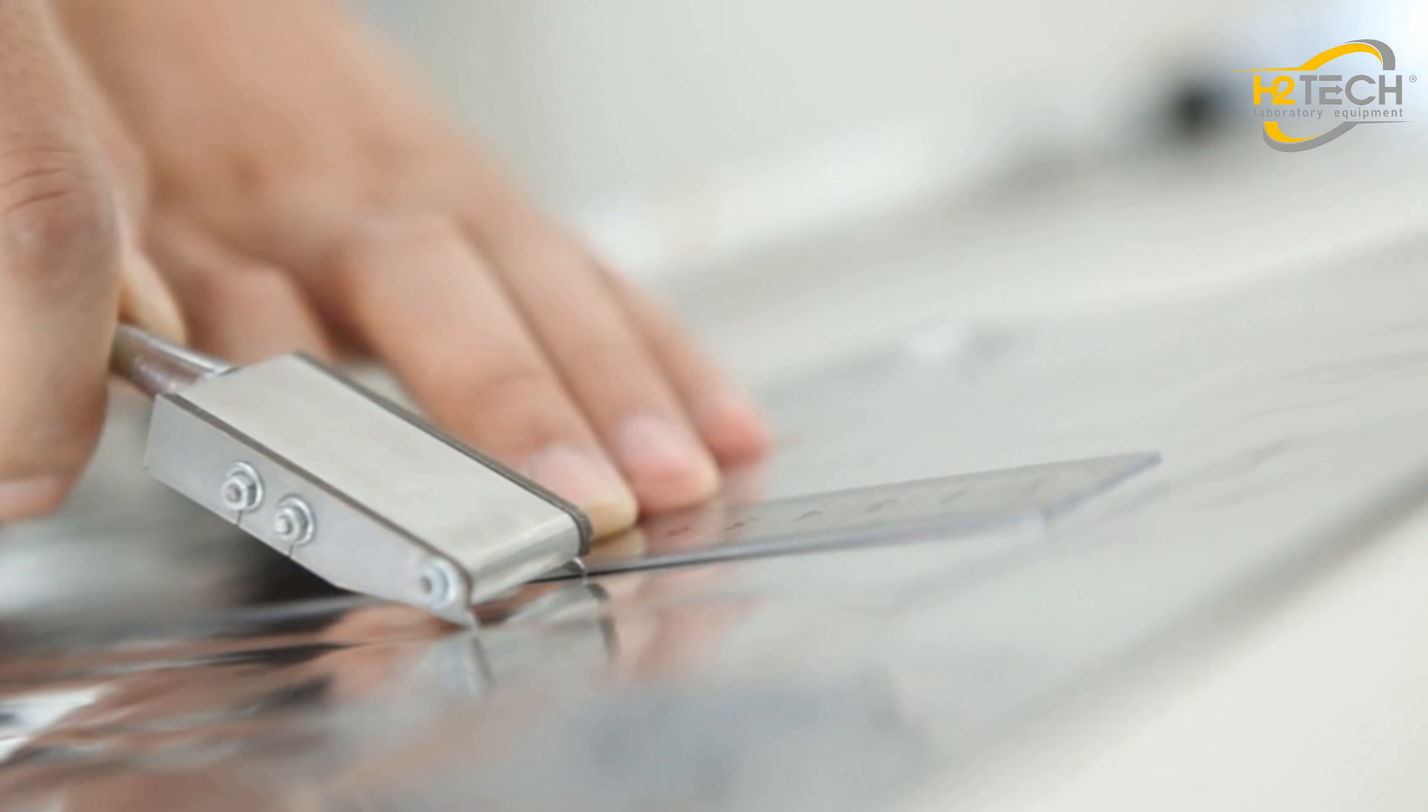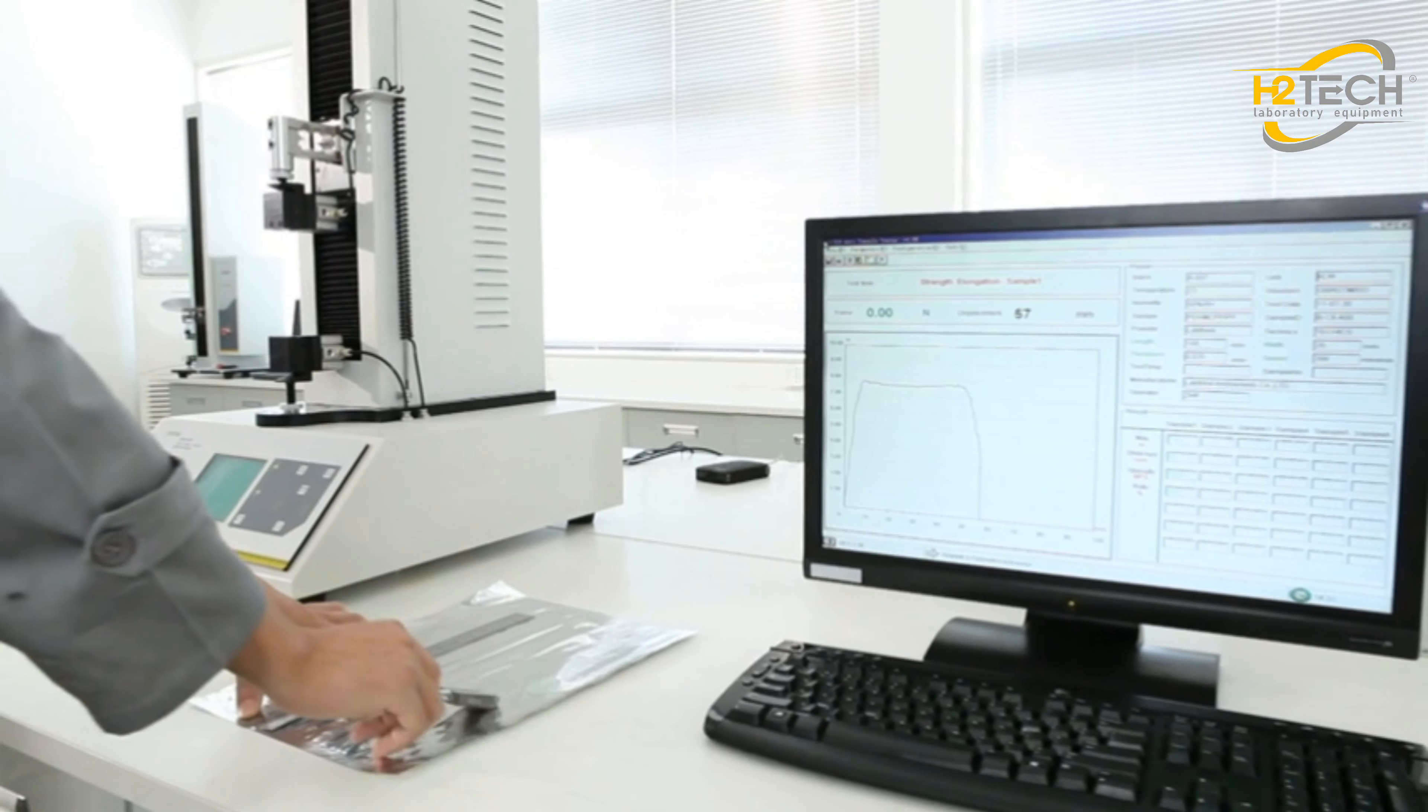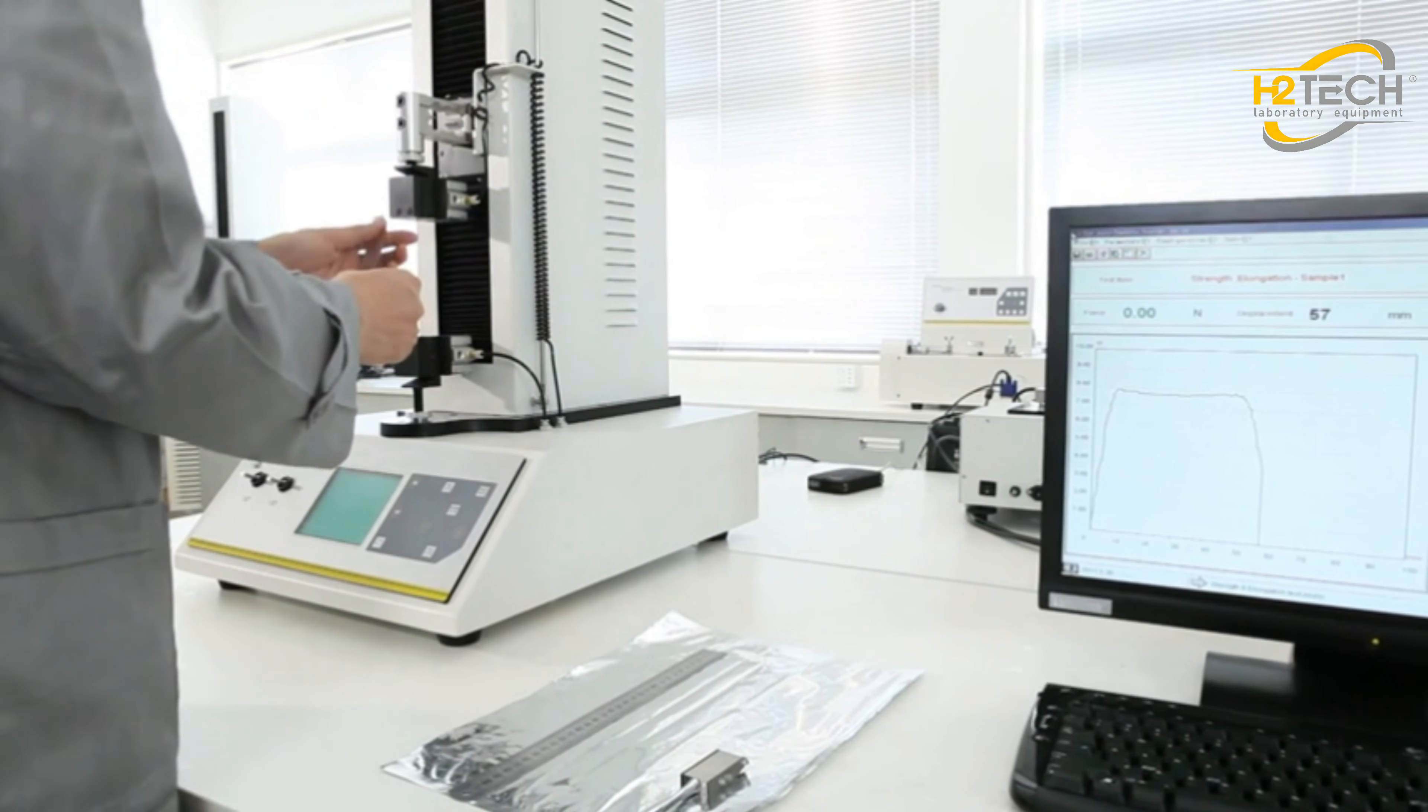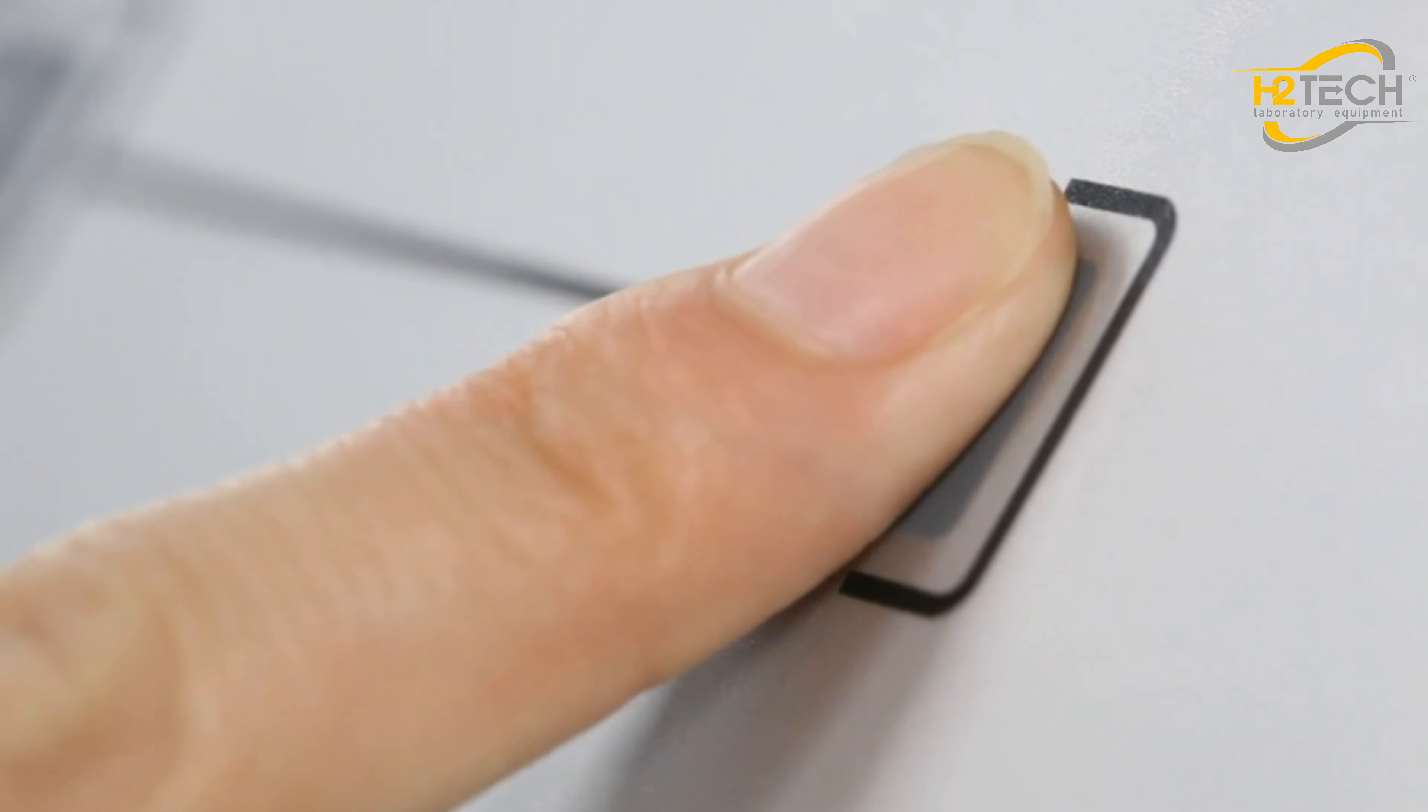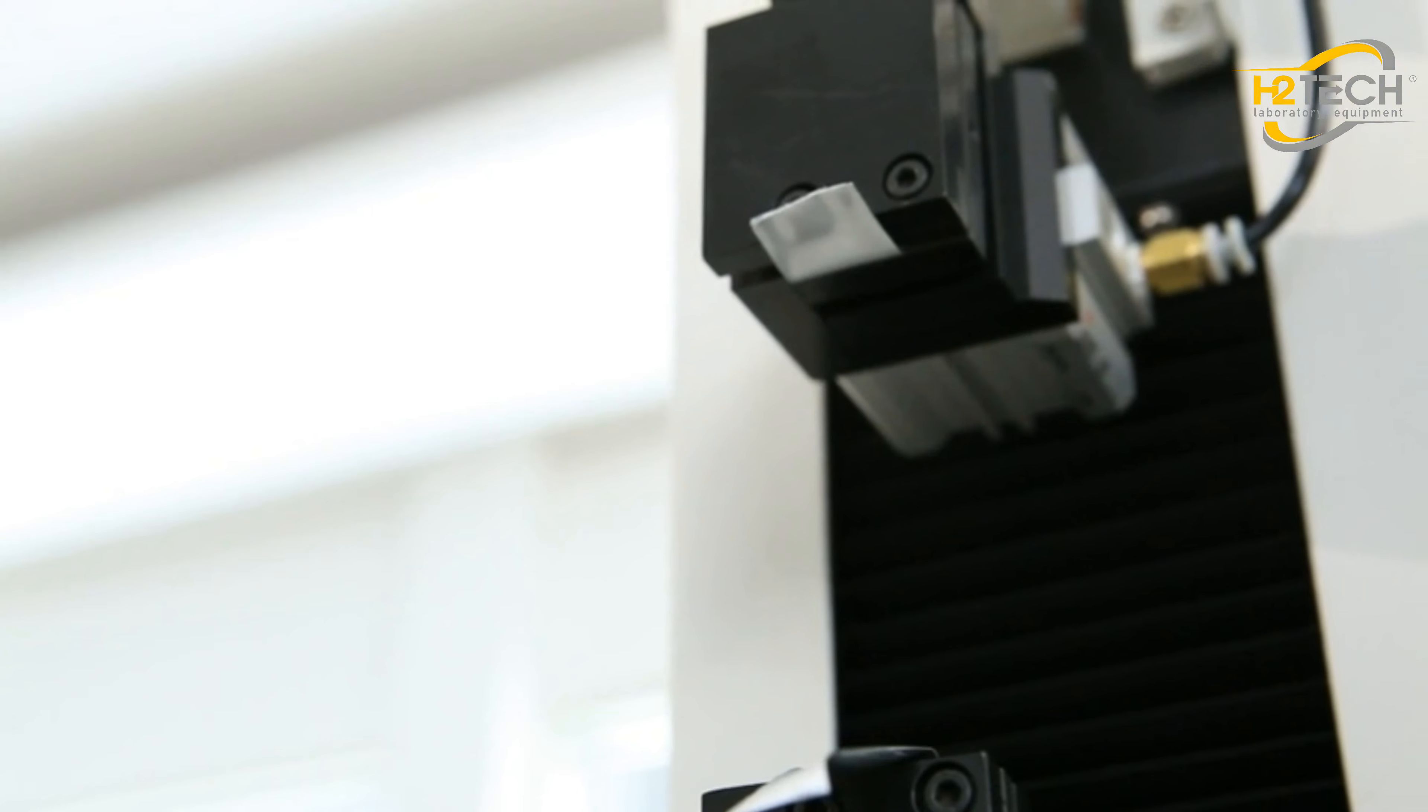Operating the instrument is simple and convenient. Users only need to place the prepared specimen on the fixture, complete the parameter setting and click on test. The XLWM will then accomplish the test automatically.